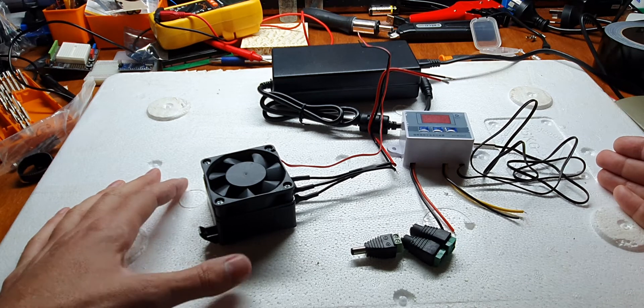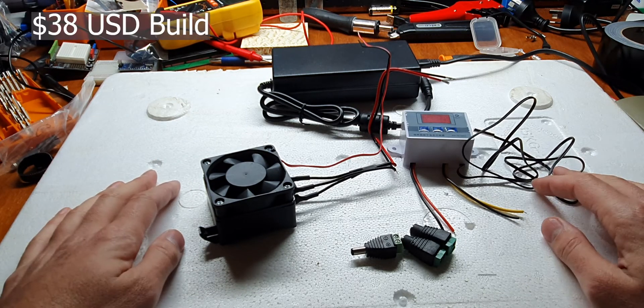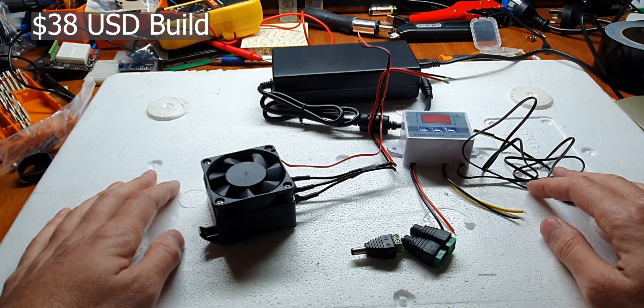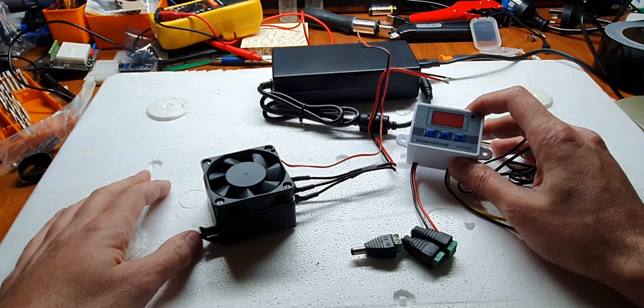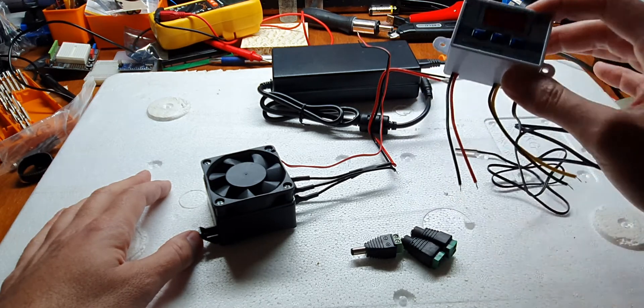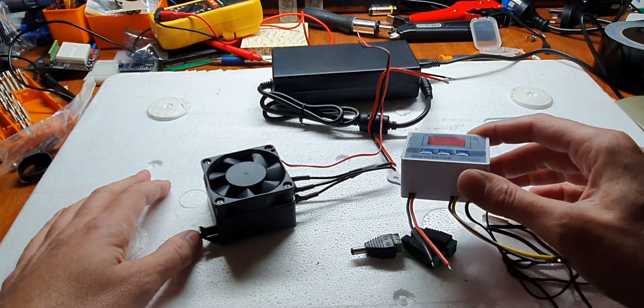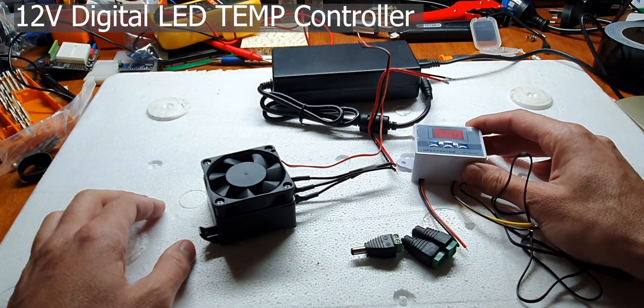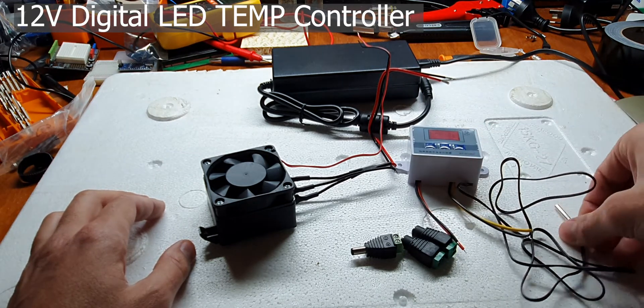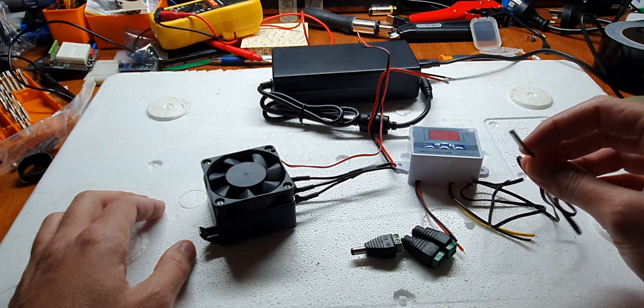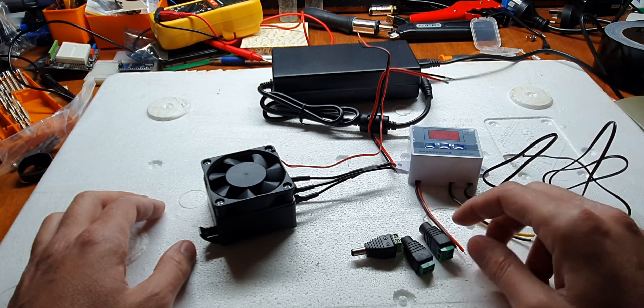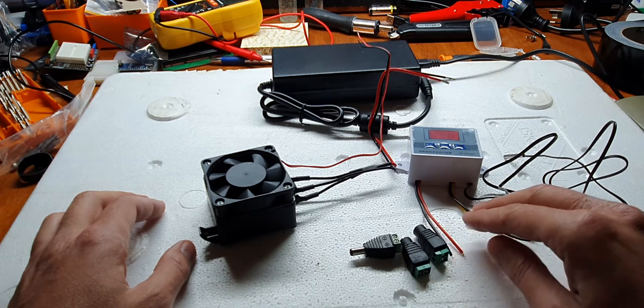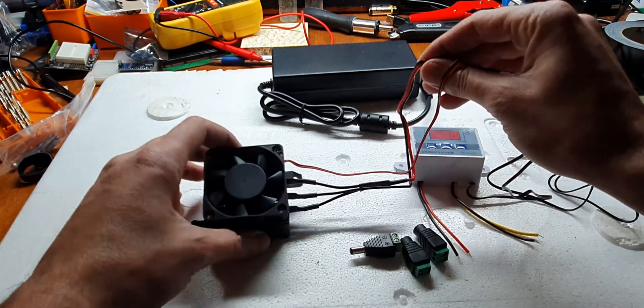So basically all up this cost me about $38 USD. To control the temperature you're going to need something that has the ability to both monitor the temperature and cycle a relay to power a heater or cooler. This device can handle about 12 volts and put out 120 watts when commanded. The temperature probe's about half a meter long, so plenty of room to place it in an incubator somewhere. The red and black pair of wires are the input and your yellow and black wires will be the power for your heater.